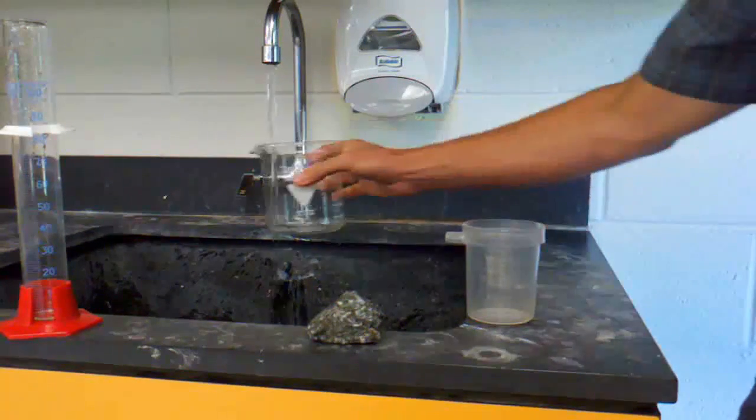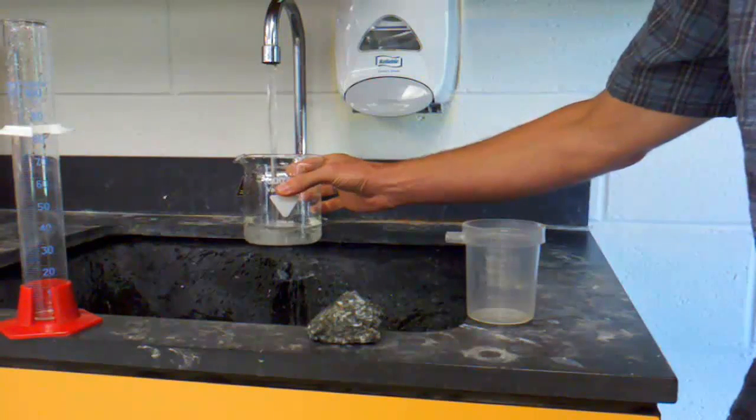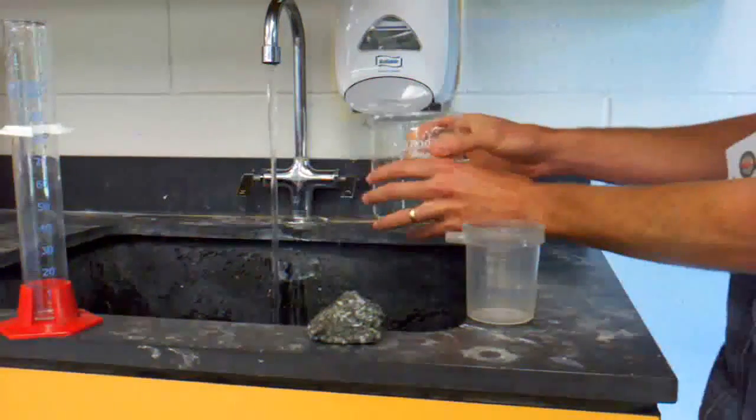I'll set the overflow beaker down on the side of a sink and collect some water from the sink in another beaker.